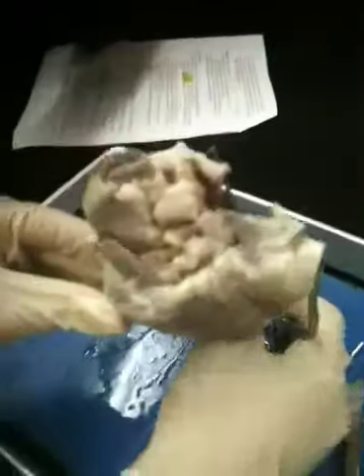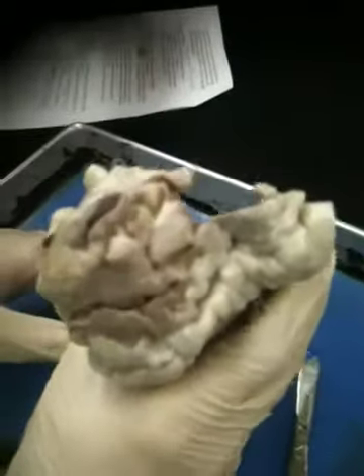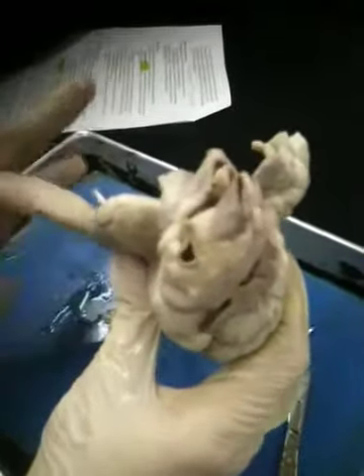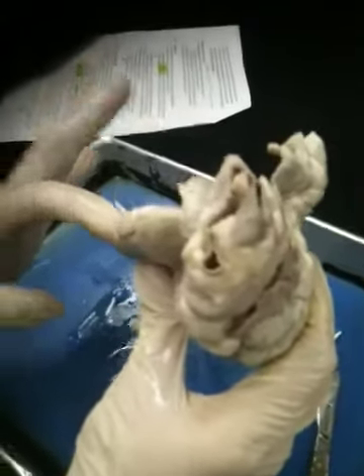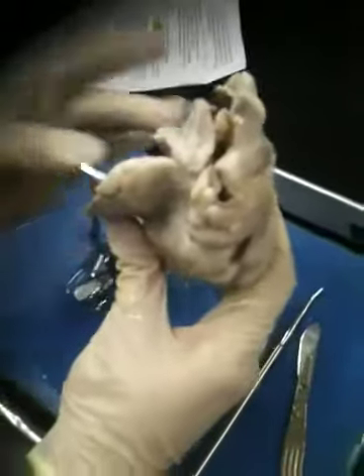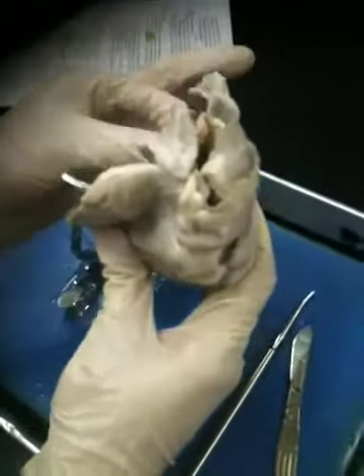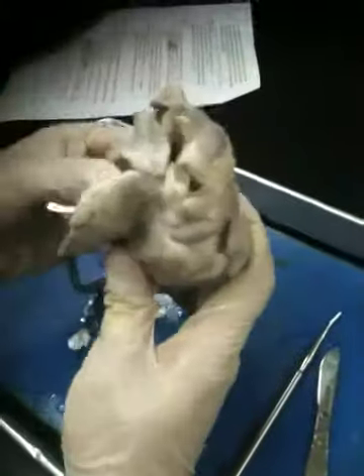Now, the idea here is that we have opened the entire right side of the heart. The way that we can tell it's the right side of the heart is notice how relatively thin its wall is. This device that I'm using, what I call a spreader, is digging into the wall, and the wall there is not that thick.